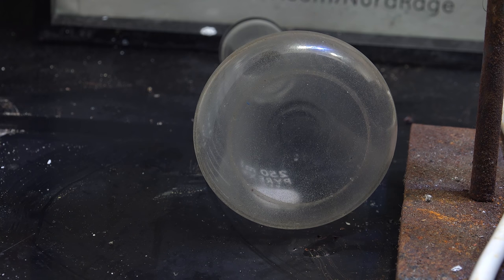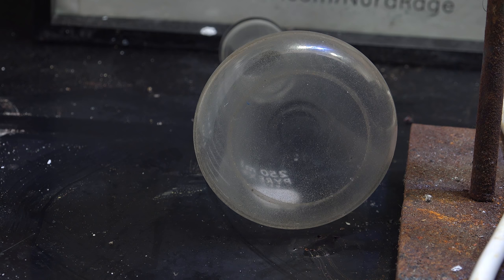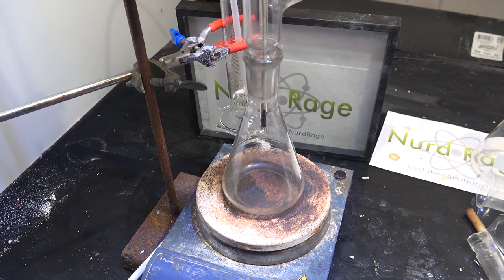So let's move on to our new round of testing. This is the flask for my next test. I'm taking pictures of it now before and after my experiments to document extremely subtle damage. And this is going to be my new test apparatus.